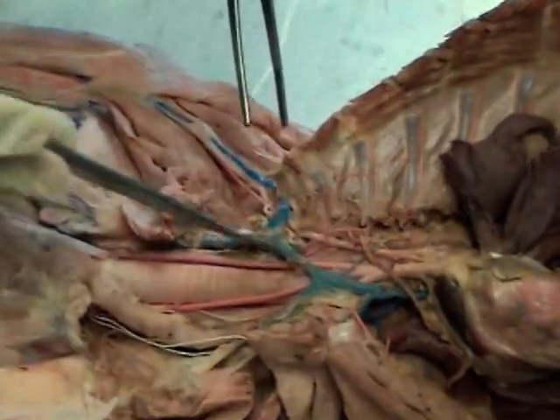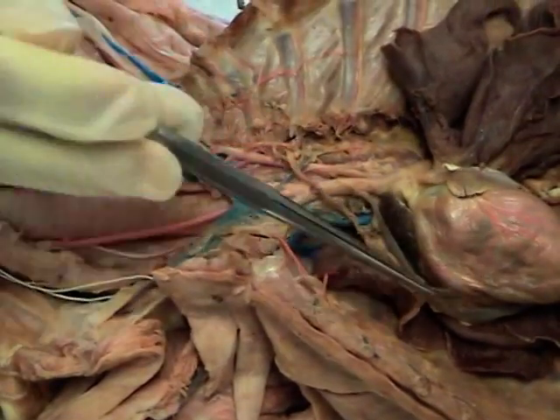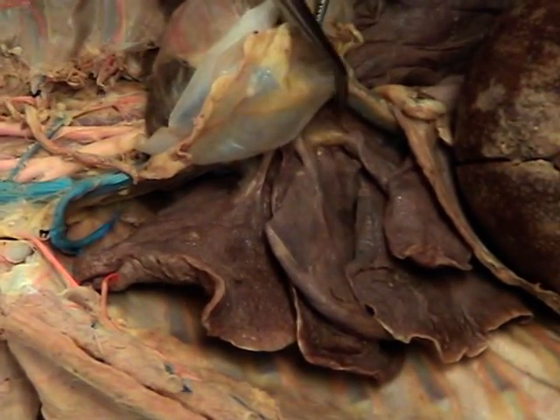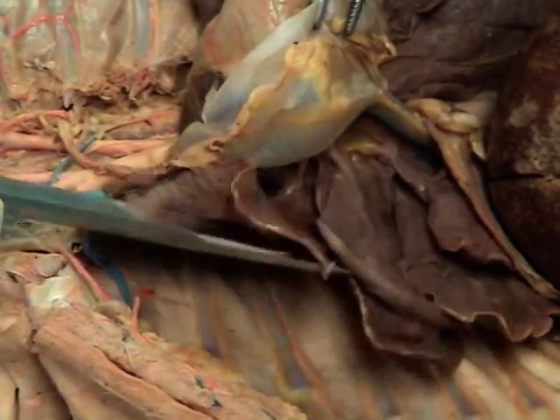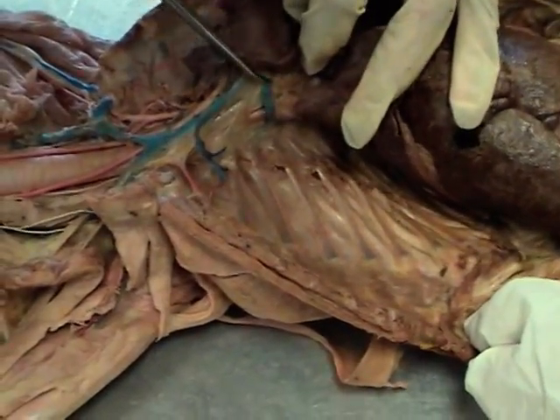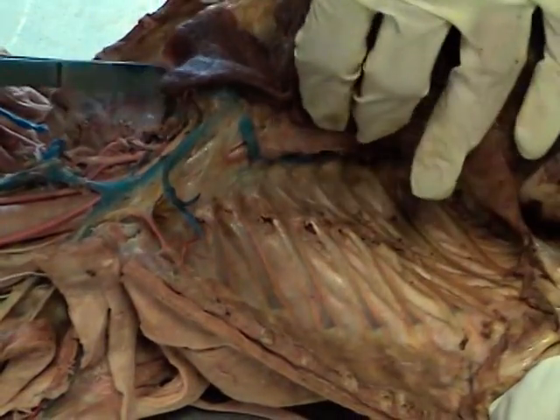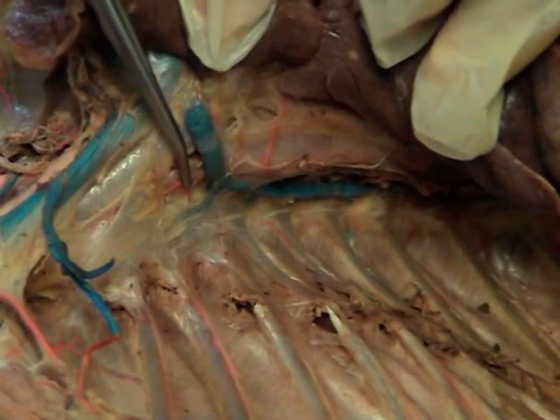That's pretty much the major blood vessels in the neck and thoracic region. One more blood vessel I want to point out is the anterior vena cava. I also want you to see the posterior vena cava — coming from the abdominal cavity going up through the diaphragm — and of course this will also empty into the right atrium. You may have remembered the azygous vein, which is found behind the right side of the lungs. If I move this up a little bit, you see this vein here — it's going to empty into the anterior vena cava, but it is not the posterior vena cava. This is the azygous vein. Don't confuse that with the posterior vena cava.